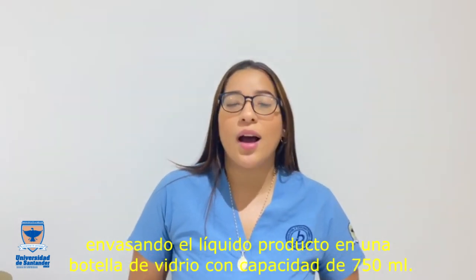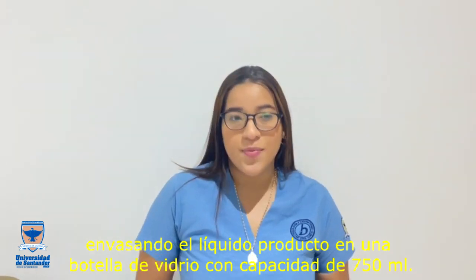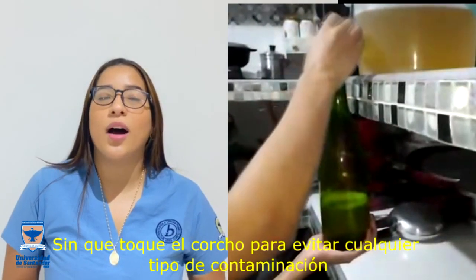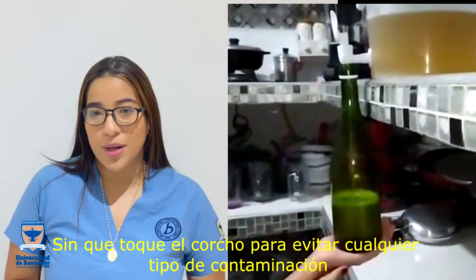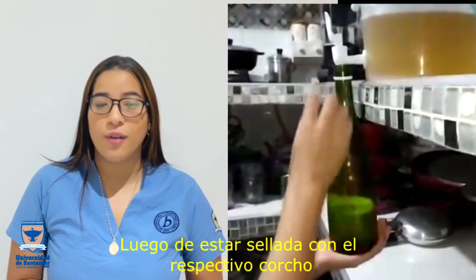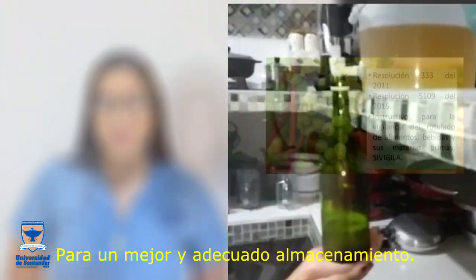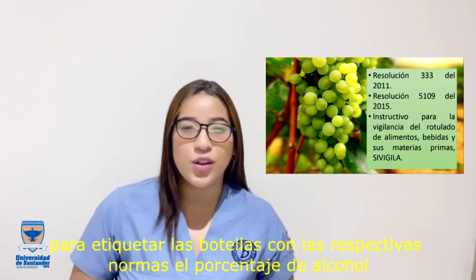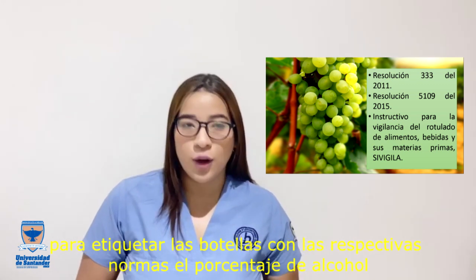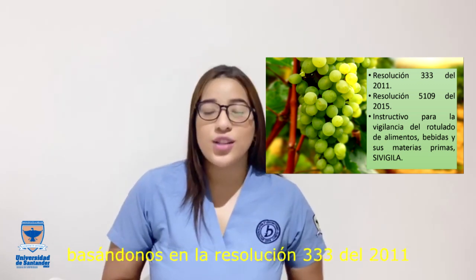Once the last filtering finished, we did the bottling process, packaging the liquid product in a glass bottle with a capacity of 750 milliliters, without touching the cork to avoid any contamination, and sealing it with the respective cork for better storage. Labeling is the last step, labeling the bottle according to the norms, with the representation of alcohol by volume.